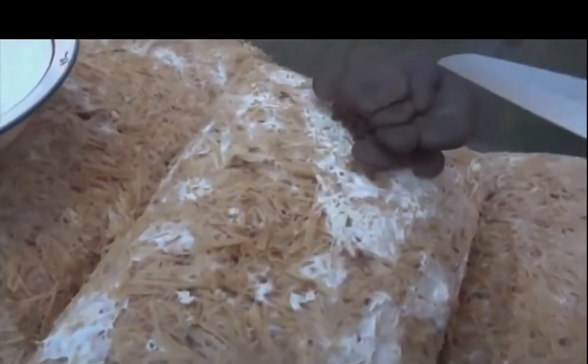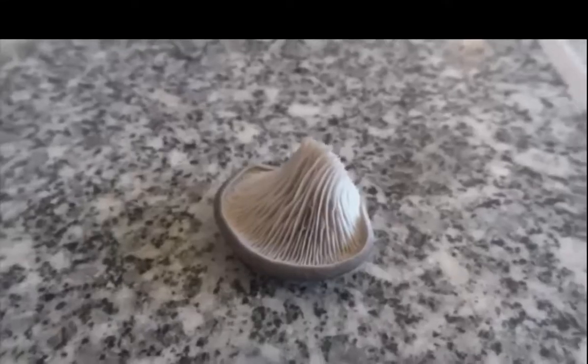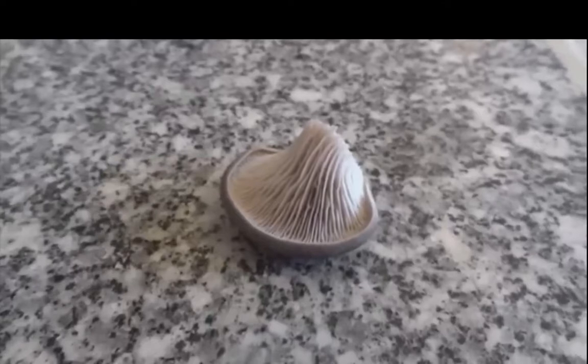But yeah, once you've got it cooking, you need to go out and find a tissue sample. Young mushrooms or pins are best, as they have the most virulent growth. Cut off one you like, and dice it up. Make sure you only get the inner tissue and not the gills, because you don't want to get spores. You want to get a clone of the existing mushroom, because you know that strain fruits very well.